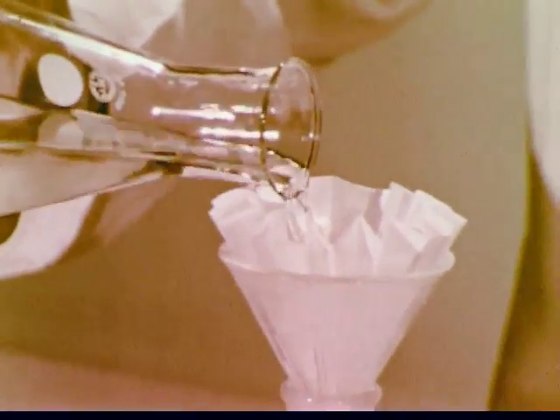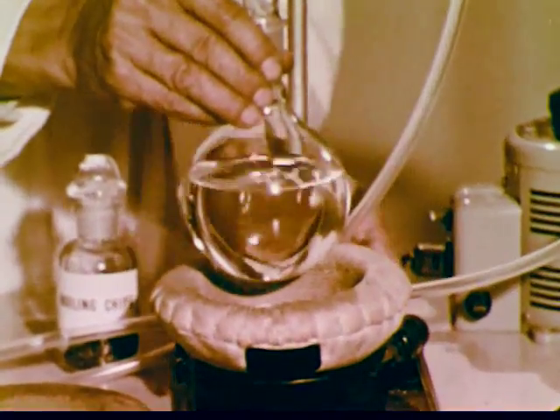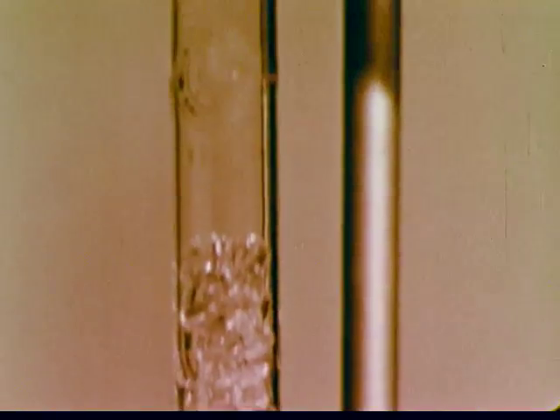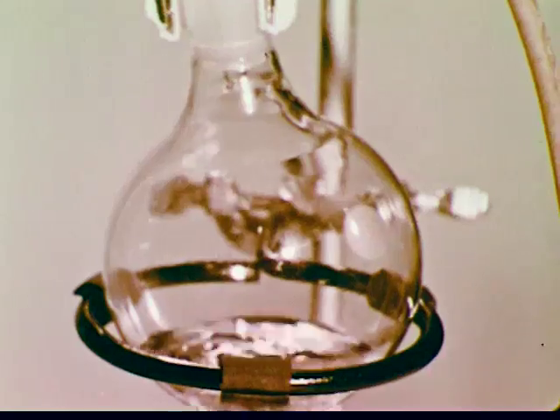The ether solution is removed from the drying agent by filtration into a distillation flask. Small boiling chips of a porous material are added because they promote the formation of bubbles and ensure smooth boiling. Because ether is being distilled, the risk of fire is reduced by using an electrical heater under the flask. In a short time, the solution begins to boil. The boiling point of ether is 35 degrees, and the ether vapors condense in a water-cooled coil and collect in the receiver. Eventually, the temperature starts to rise above 35 degrees, indicating that most of the ether has been distilled.